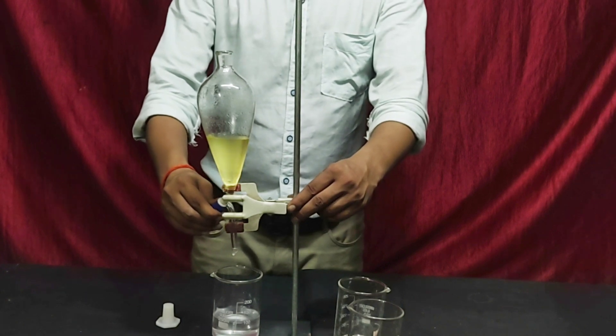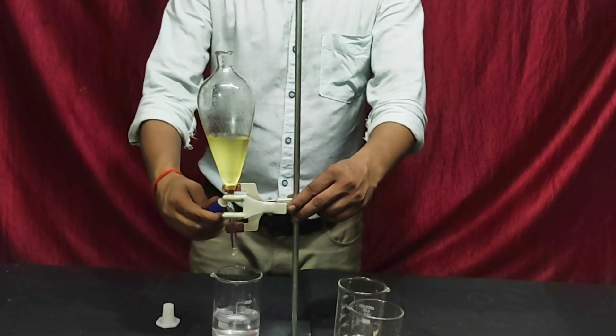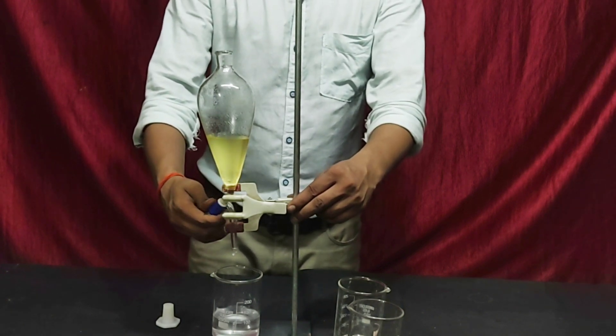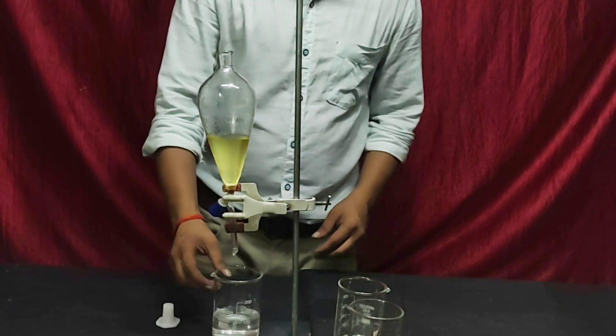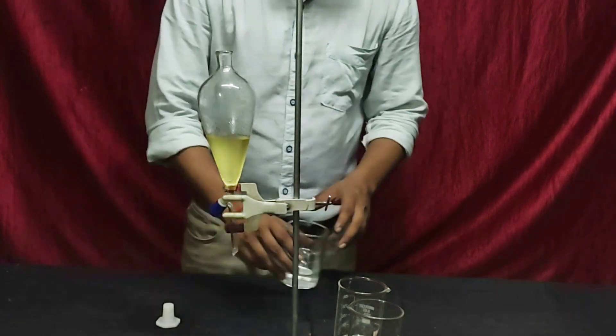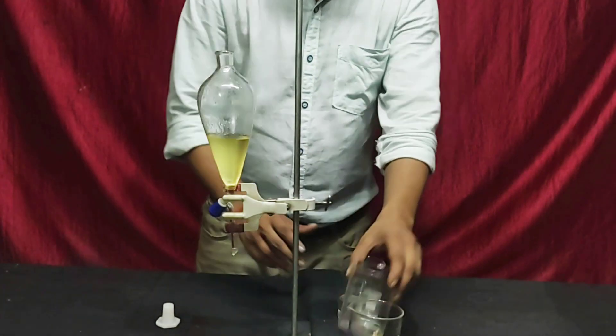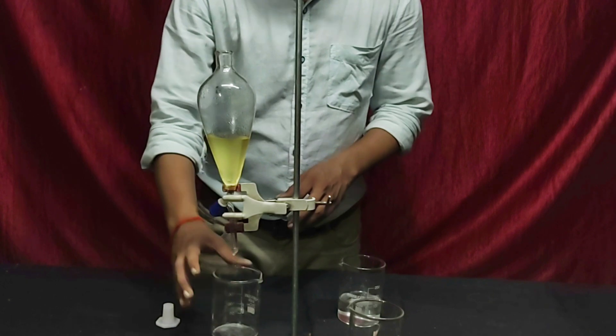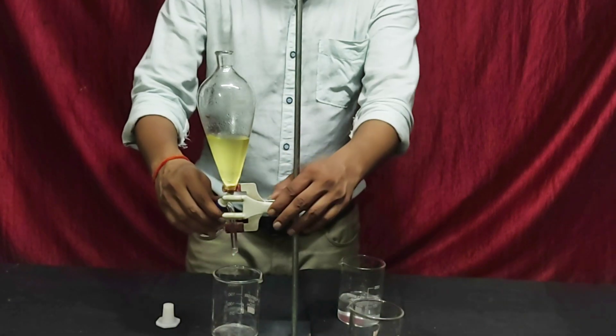Close the stopcock as soon as the lower layer has been transferred to the beaker. Now collect the upper layer in a separate beaker.